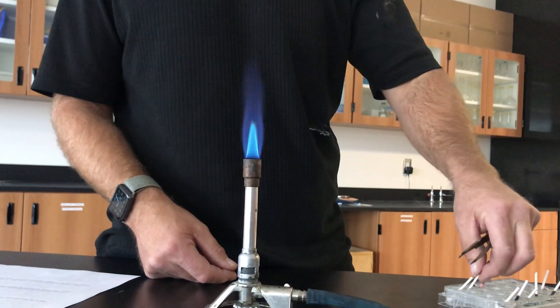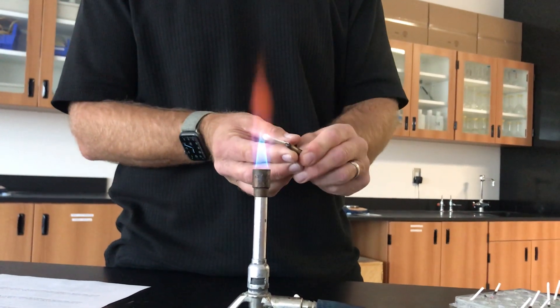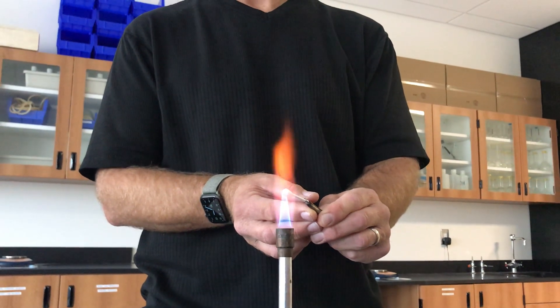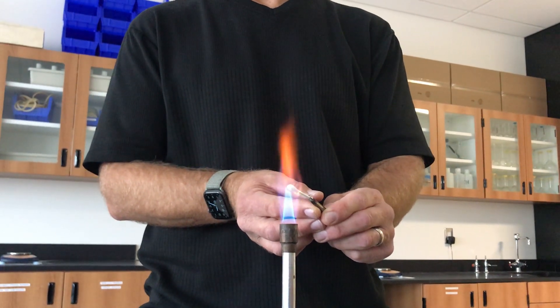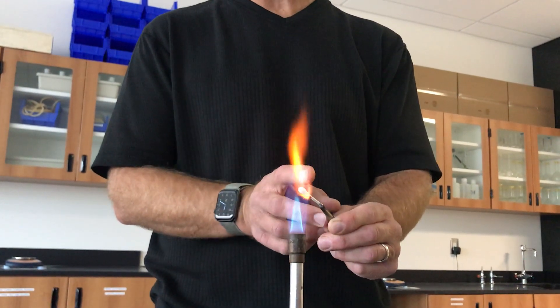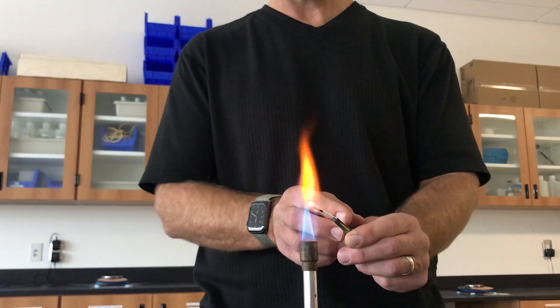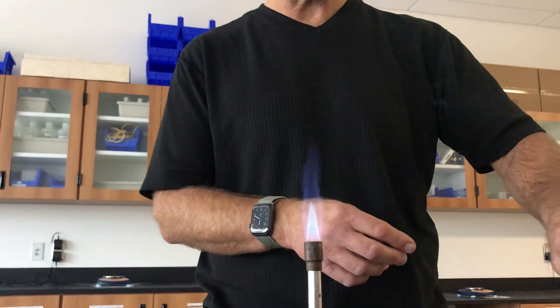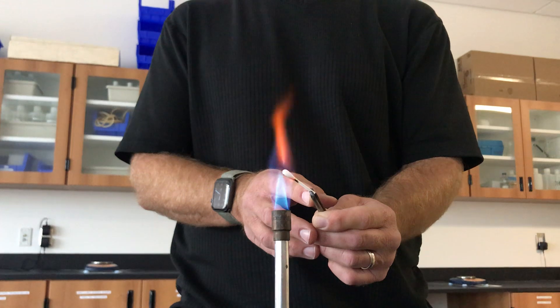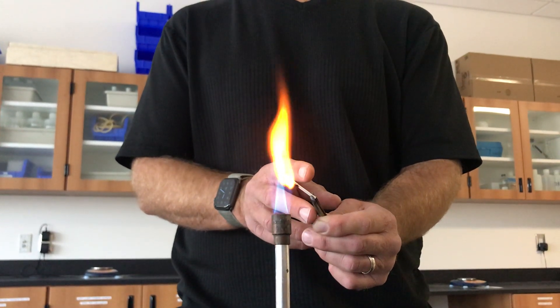Let's move on then to unknown B. There's your color for unknown B over here on the right-hand side of your image. Let's do that again — there it is. There's your color for unknown B.